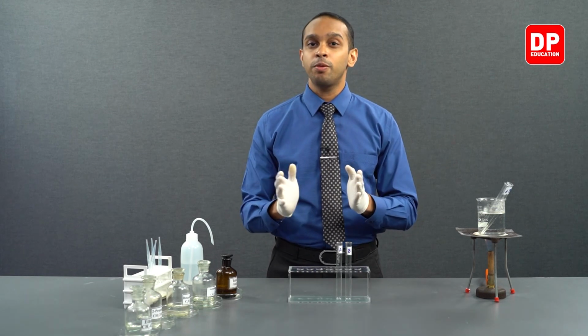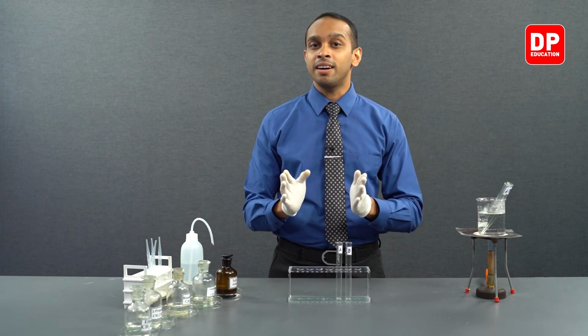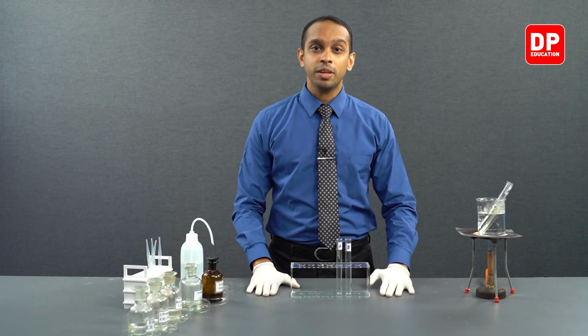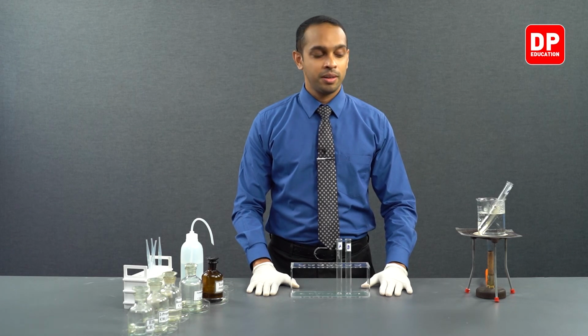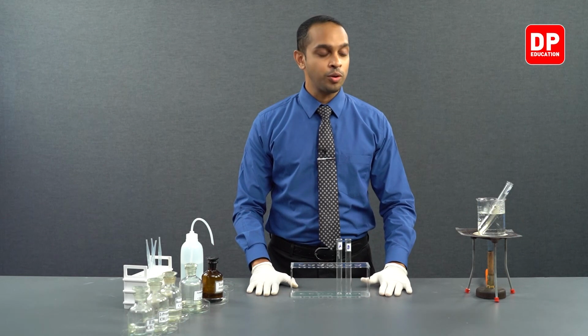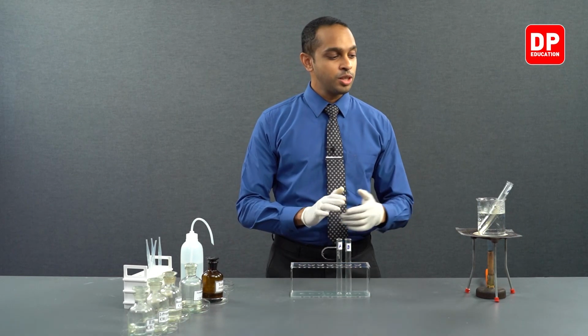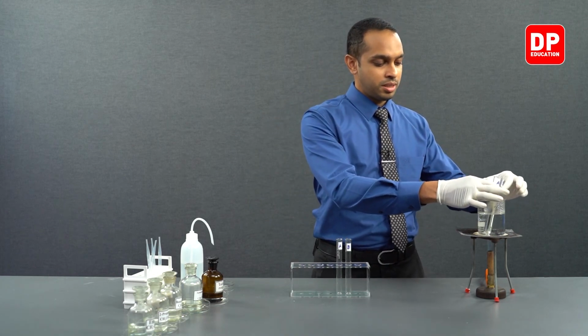When we heat it up for a duration, we should get the result of seeing a silver mirror. Students, we have allowed the two test tubes to heat up for a small duration, right? So after about 5 minutes, now we are going to observe the changes of the two test tubes. So let's take the two test tubes.